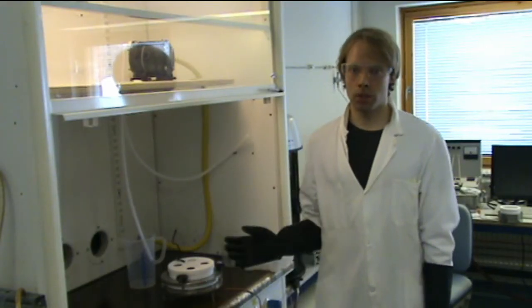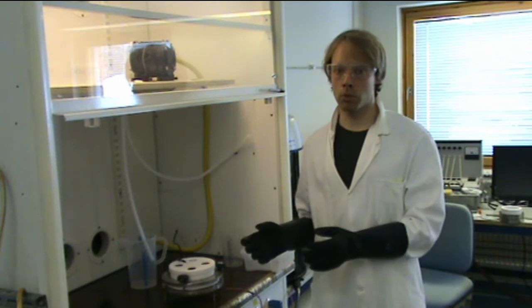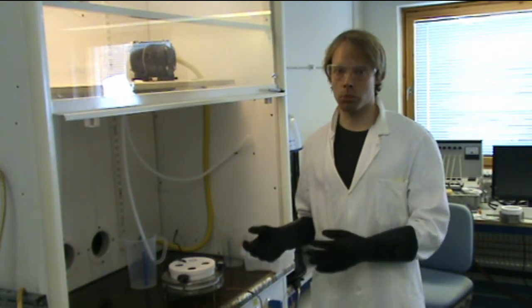Now the etching is finished. So first I will remove the electrode and then the electrolyte from the etching cell.